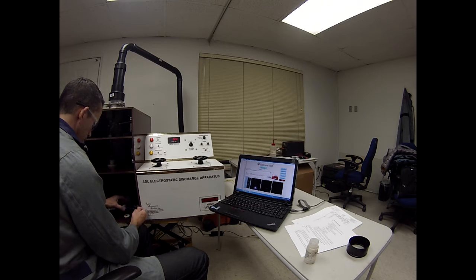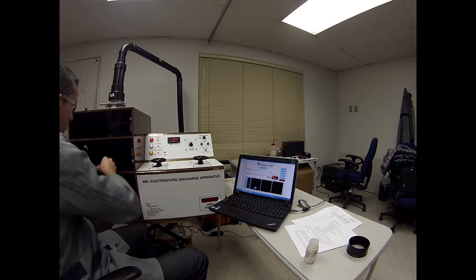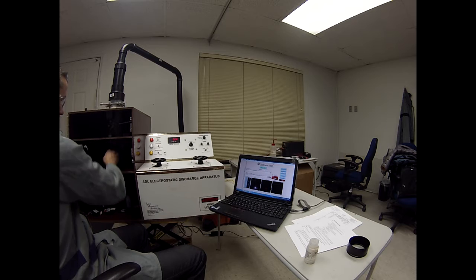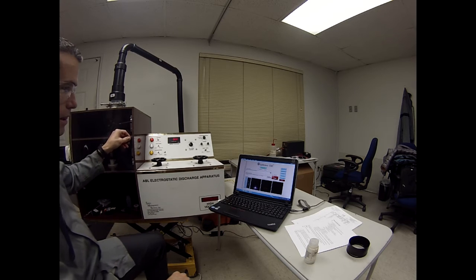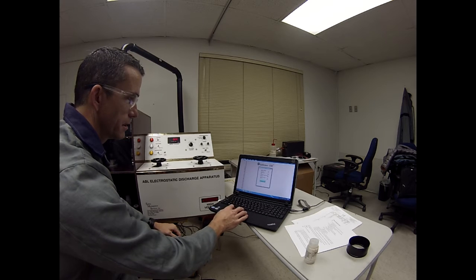We use sand as our baseline. Again, you don't have to reapply the sand between each baseline shot. Change settings.